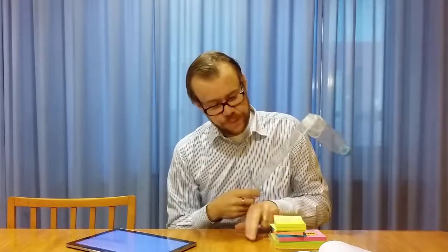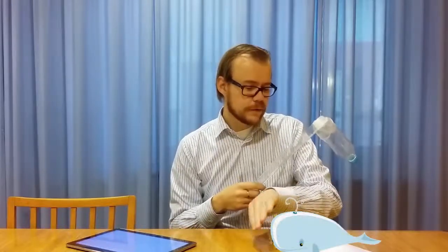Another thing is that if you're too slow, the tip might go like this, and then it will get stuck like this, and then comes over. And then it is very slow in compensating. So it will take a very long time before it comes down again. And that means in the final image, the contour of this will be sort of like a whale. It has a steep curve here, and then it will smoothen out into a slide.